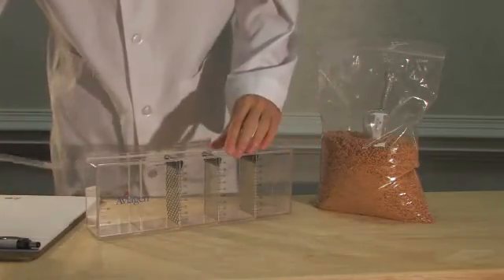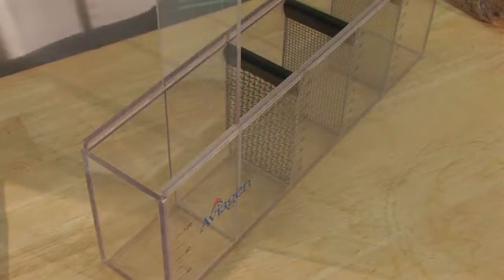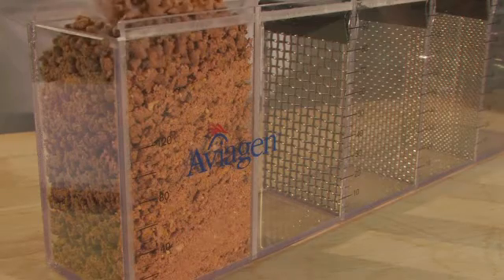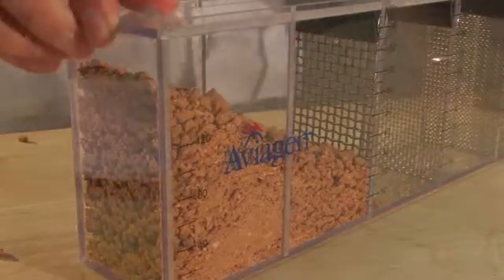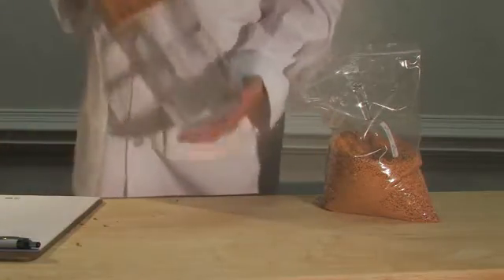Remove the lid and slide the lid vertically into the groove in the center of the first compartment, labeled greater than three millimeters. Then fill the left compartment only with feed sample. Take the lid out of the vertical groove and slide the lid back to close the shaker. Turn the sieve so that it stands vertically upright with the largest compartment at the top. Shake the sieve for approximately one minute, making sure you shake vigorously as the fine particles have to move all the way to the last compartment.